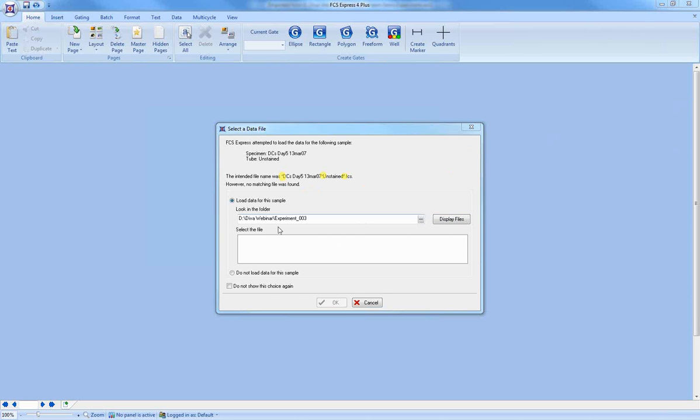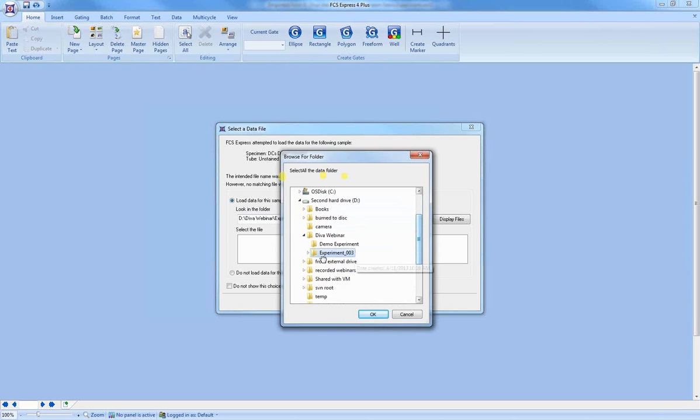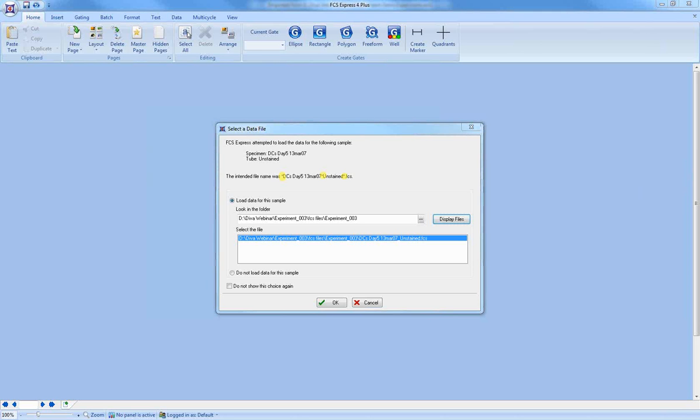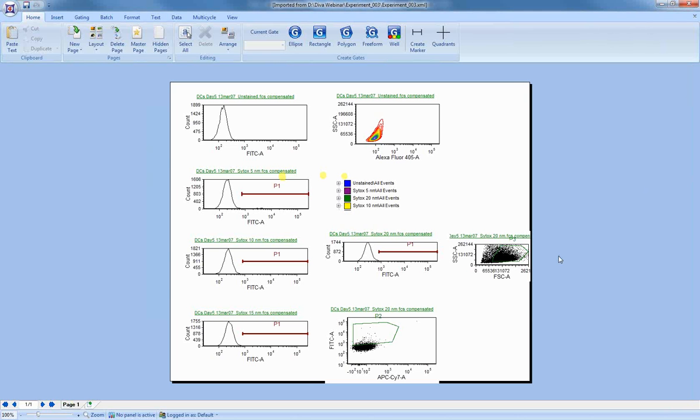So it's now asking to look in the folder. I remember that I put it under experiment 3 under FCS files. I'm going to click on display files. This button looks in this particular folder for anything that matches the wildcard file specifier that I was showing before. So I press OK, and you can see that everything was found and the plots opened and everything looks great.